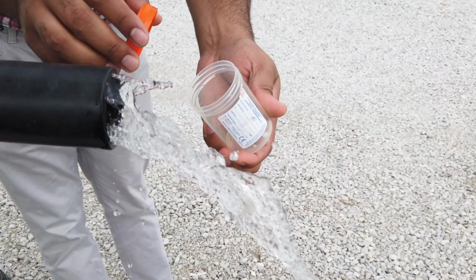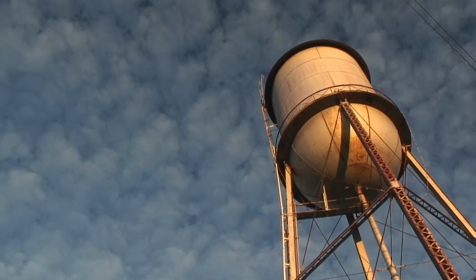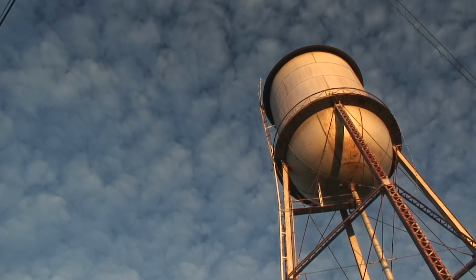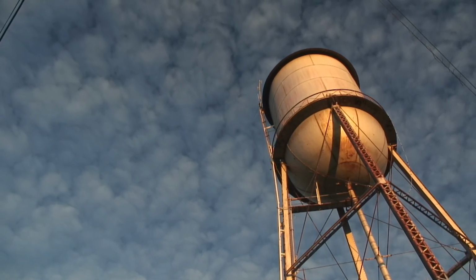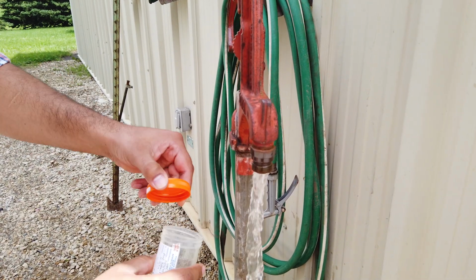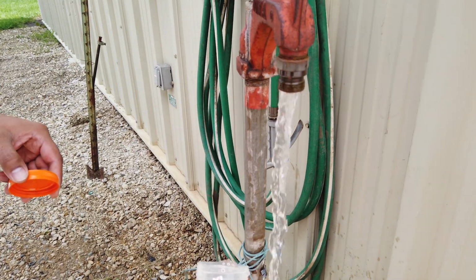Well water samples should be taken from the tap used to draw production water. For public water supplies, water testing is typically performed regularly, and test results can be obtained from the utility. It may be a good practice to sample and test at the point of use to ensure that there are no issues with the water distribution system.